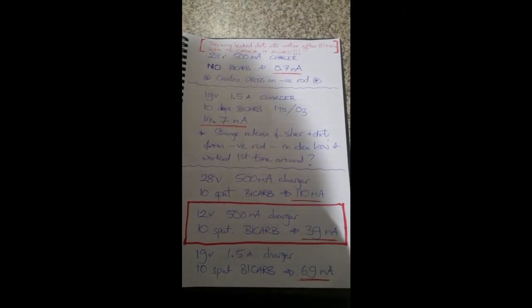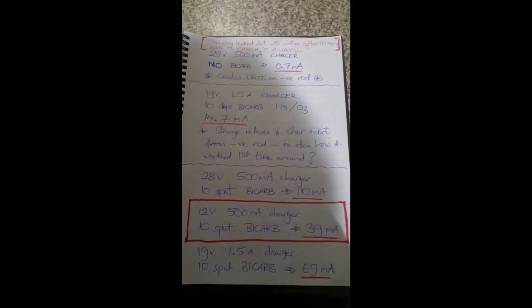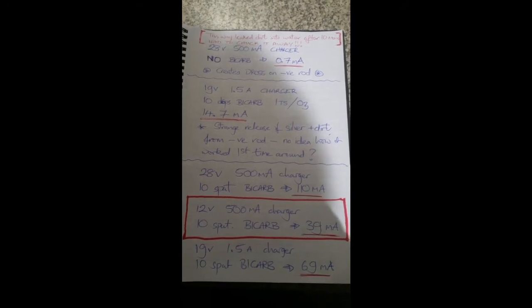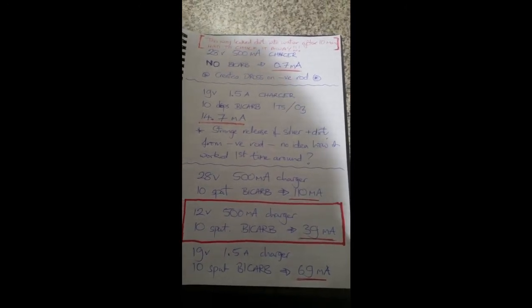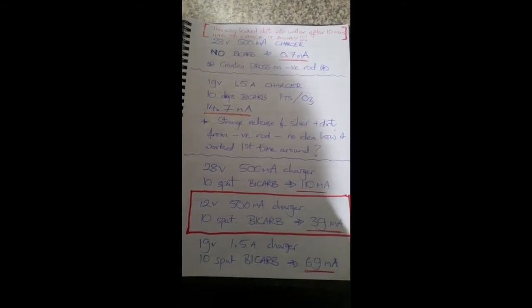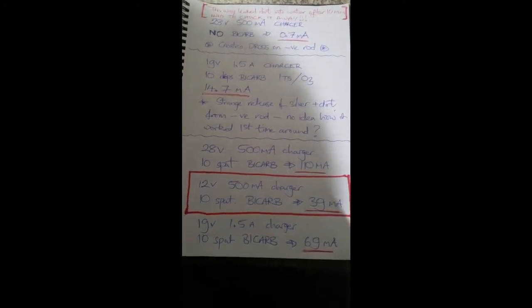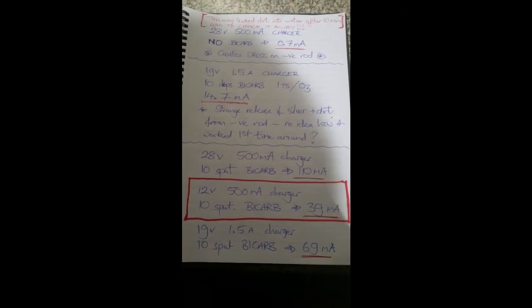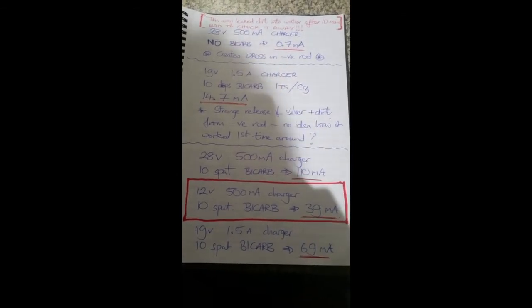I've tried to get the current as little as possible, and this has been part of the problem because as you can see, the lower the current, the more issues I seem to have with dirt coming off the negative rod.